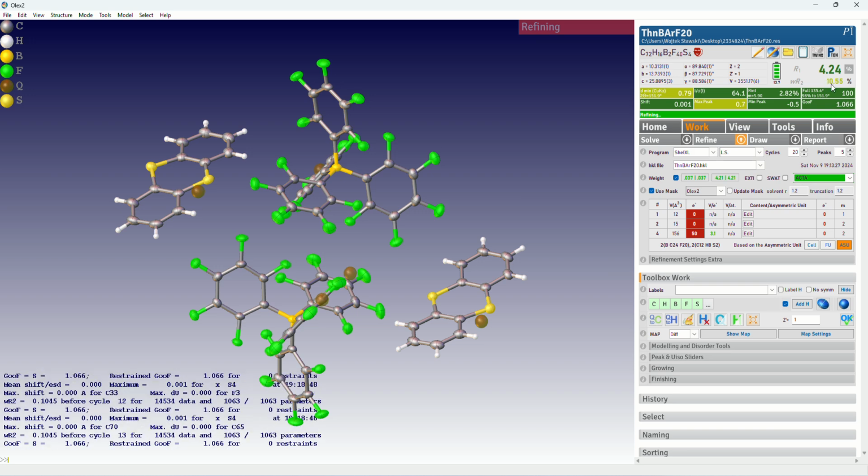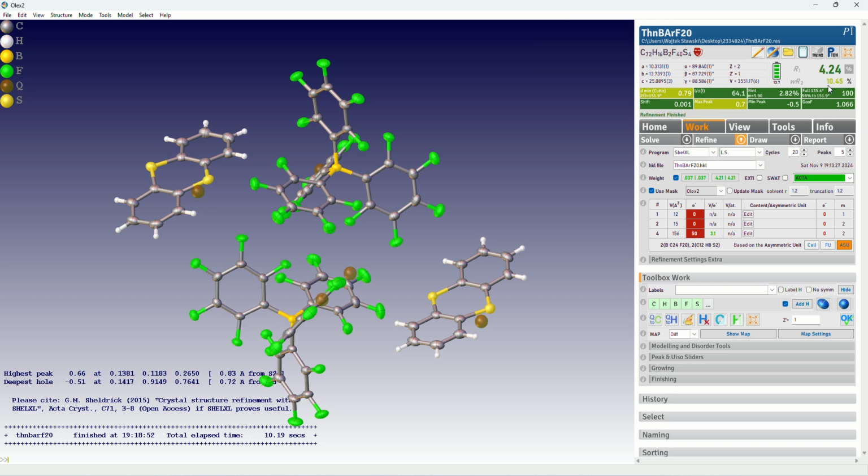Also, in general, you shouldn't do solvent masking, for example, when it's important for charge balance. So you shouldn't do that for anions that you have in your structures. But then, of course, when you have very large supramolecular structures and solvent and counterions are terribly disordered, sometimes we have to do that, right? But in general, don't do that. Also, never do solvent masking on things that are bound to the main molecule. For example, if you have some supramolecular complex that has a template inside, do not try to do masking on the template. It's just not something that should be done.